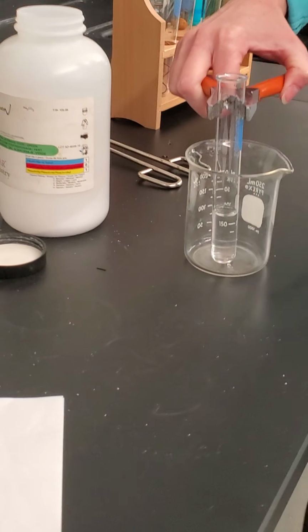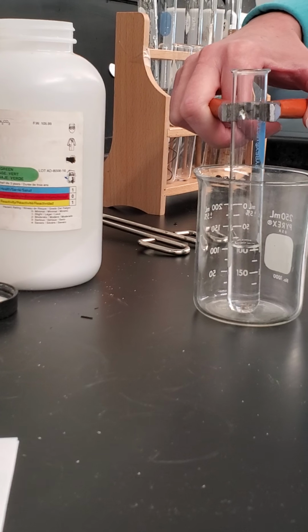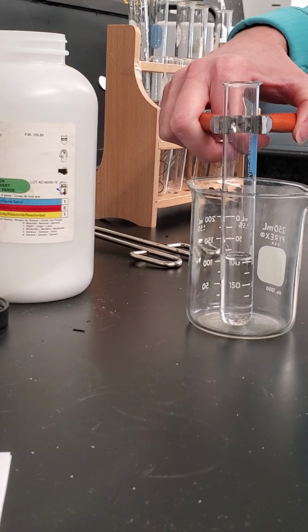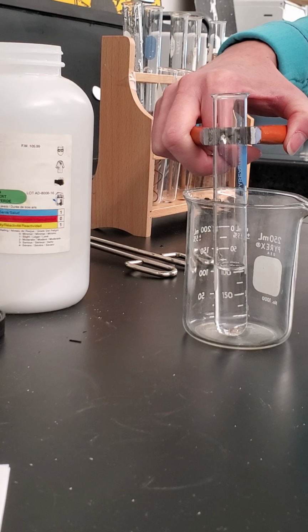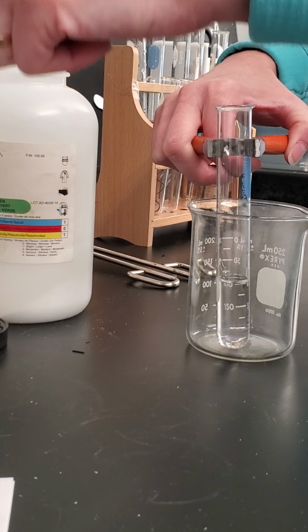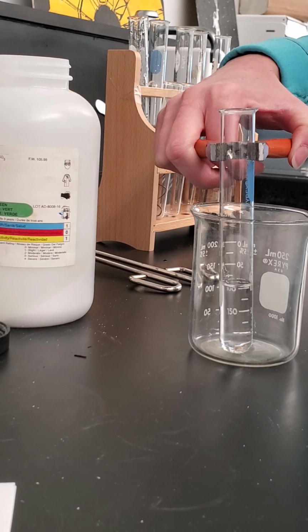This reaction is interesting because it's a compound reacting with a compound, so we'd expect two compounds to be formed, which does happen. There's two compounds formed. One of those compounds that is formed is hydrogen from the hydrogen sulfate combining with carbonate from the sodium carbonate. So we get hydrogen carbonate.